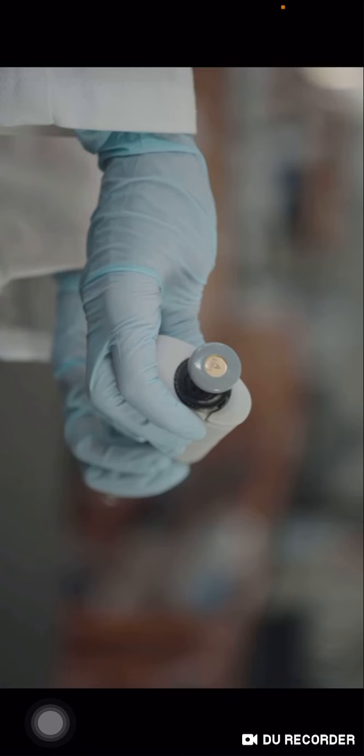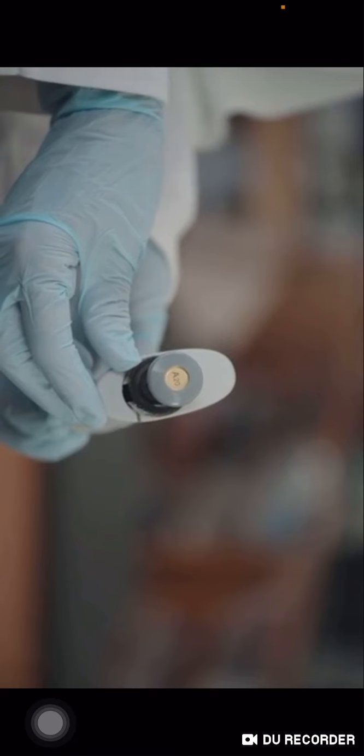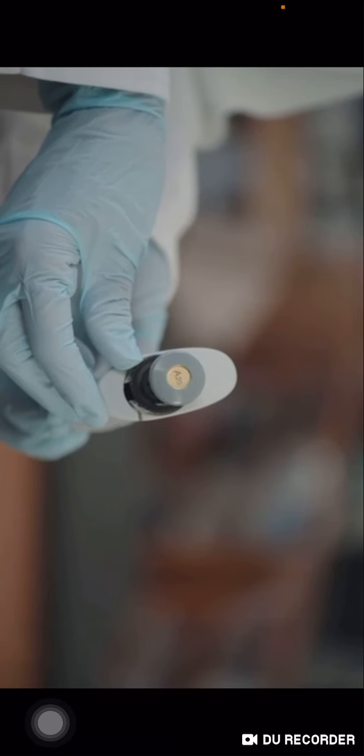The micropipette, as we know, is used inside the laboratories to transfer small quantities of liquid, and it is most commonly used in chemistry, biology, pharmaceutical and drug discovery labs. The micropipette also measures volumes in microliters. There are different types of micropipettes for measuring different ranges of volumes. Each pipette is marked to indicate its range of volumes.